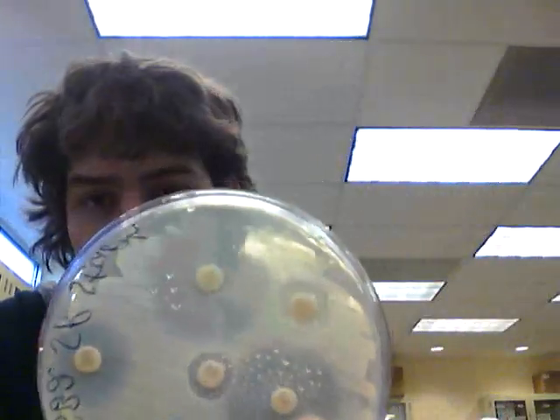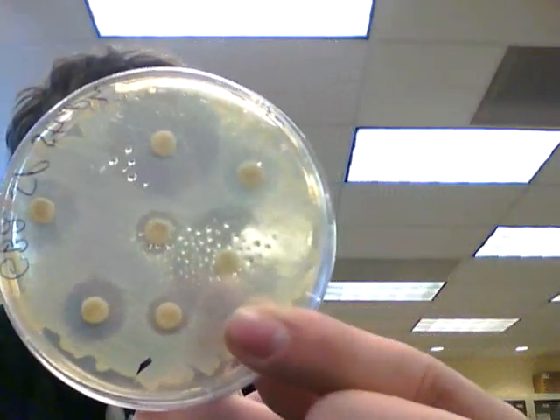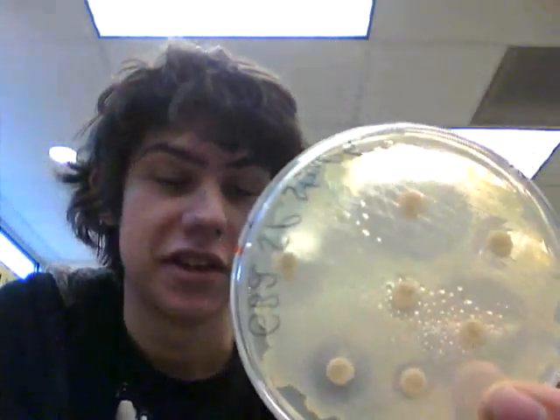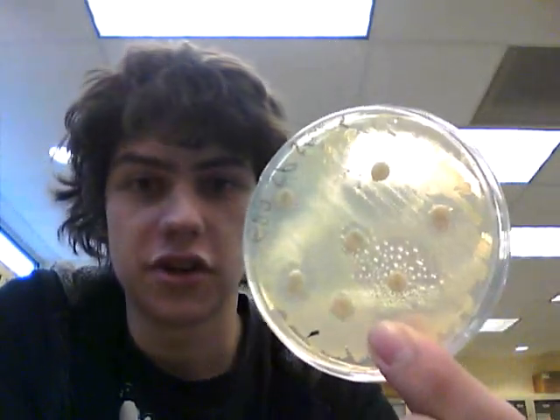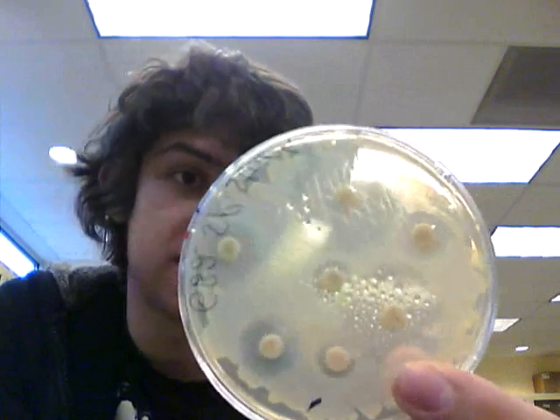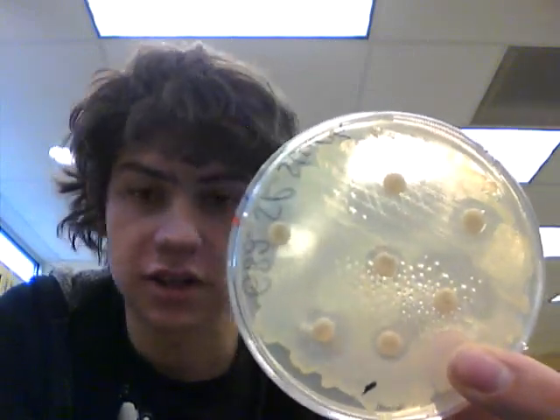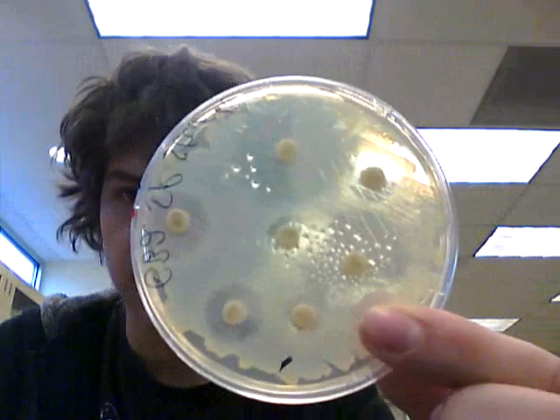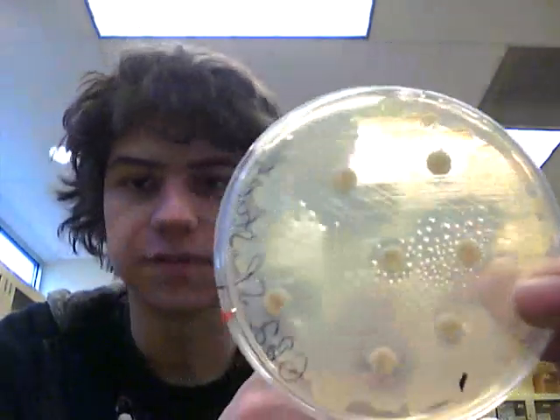The penicillin circles are pretty big. It turns out — somewhat surprisingly — that this strain of strep is susceptible to penicillin.